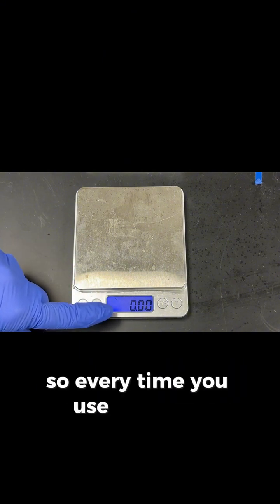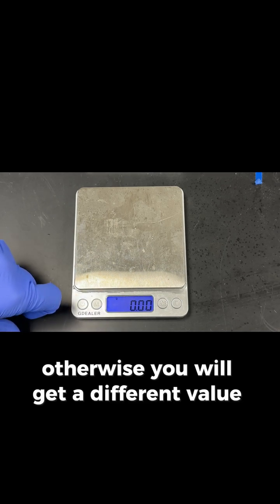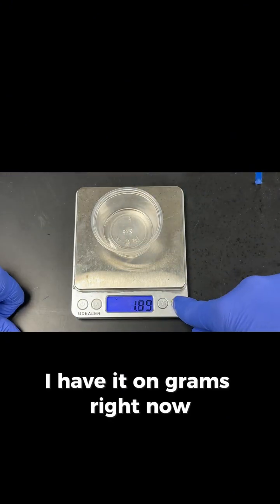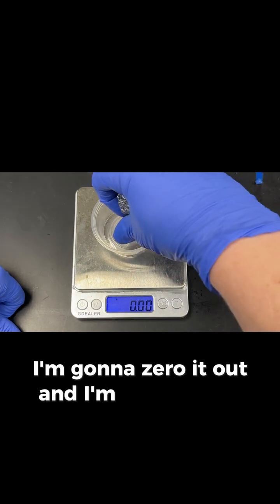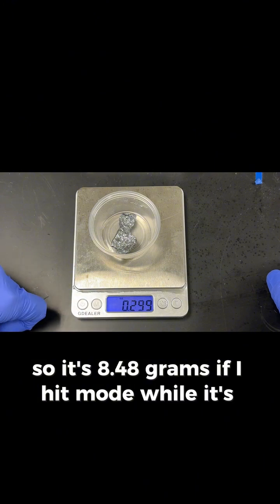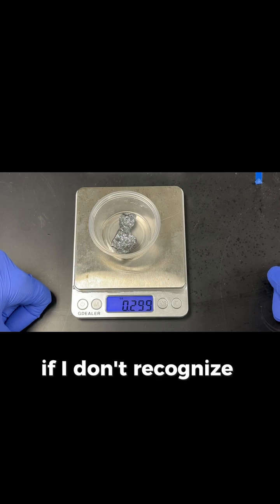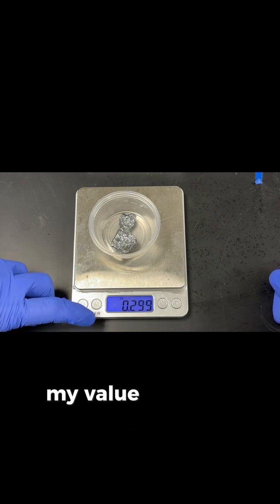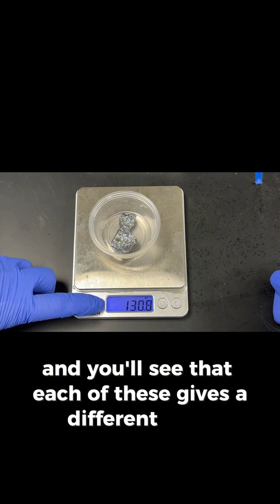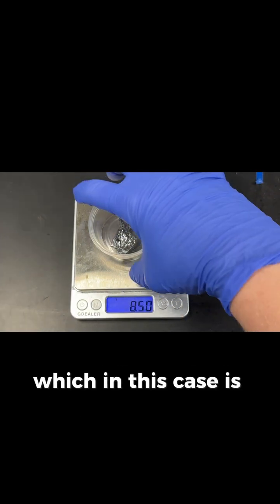So every time you use the scale, you need to make sure that it's on the correct setting. Otherwise, you will get a different value for your object. And I can demonstrate that. I have it on grams right now. I'm gonna zero it out, and I'm gonna place my object in there. So it's 8.48 grams. If I hit mode while it's on there, you'll notice now it's 0.299 ounces. Well, if I don't recognize that that's ounces and I think it's grams, my value is wrong. And you'll see that each of these gives a different value. And so we want to make sure we're always in the correct unit, which in this case is grams.